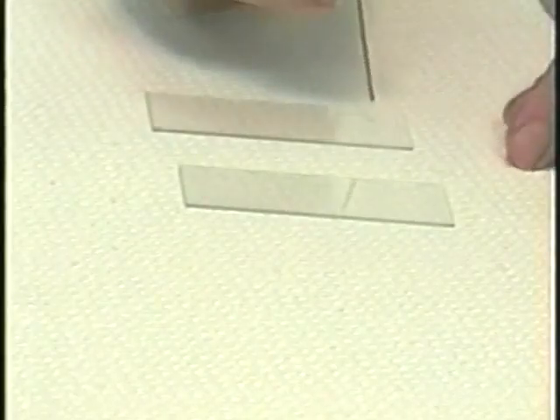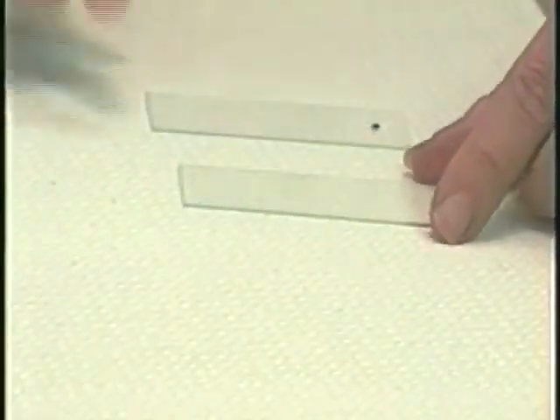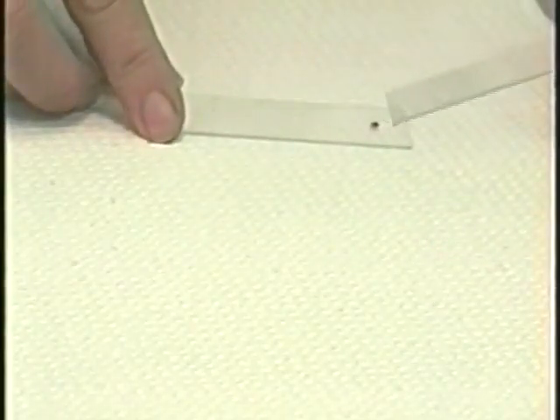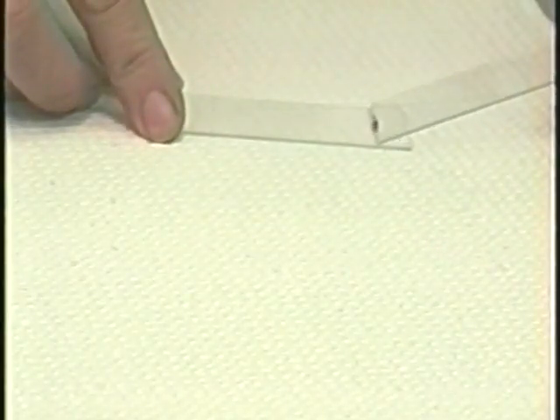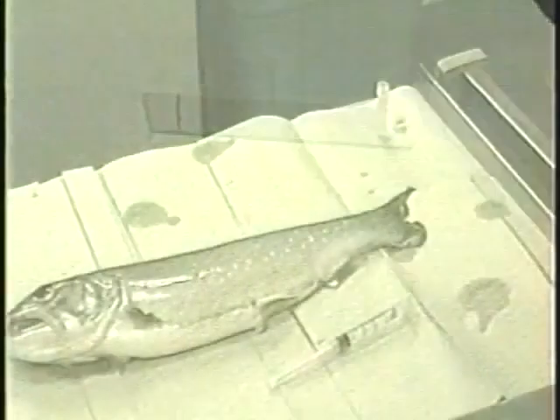Place a drop of the blood on a slide, then seal the tube. To make a blood smear, place a second slide at an angle to the first until it just touches the drop of blood, then push it forward across the slide to make a thin film. Let the smear air dry and stain with an appropriate stain such as Leishman Giemsa.